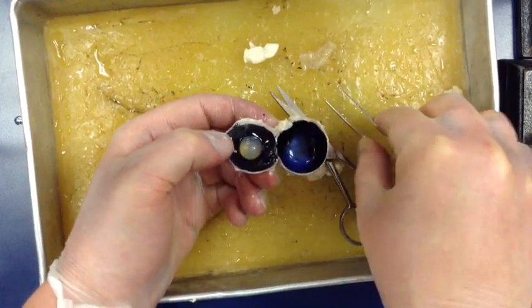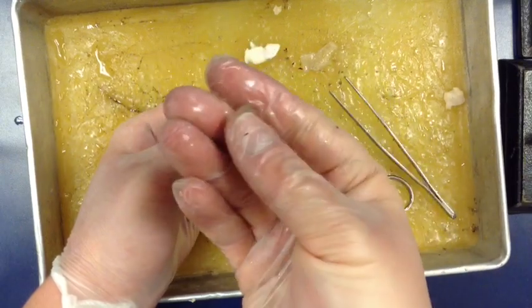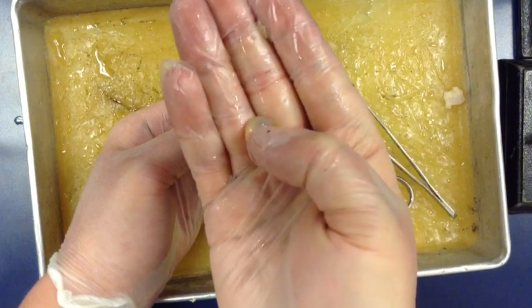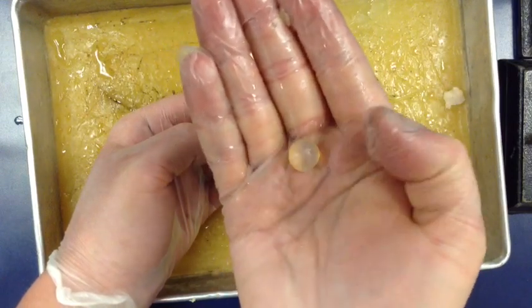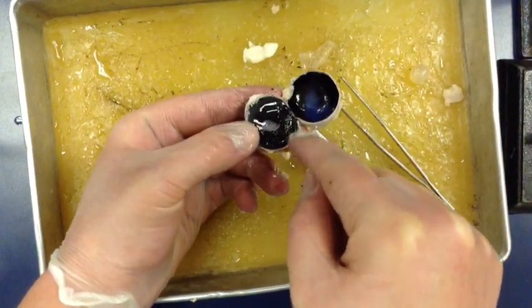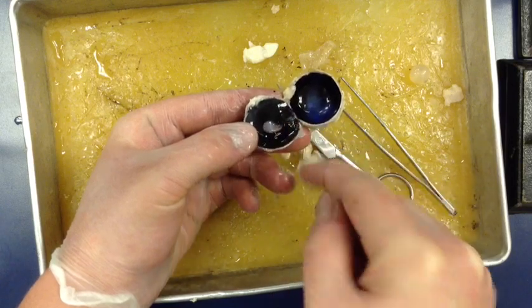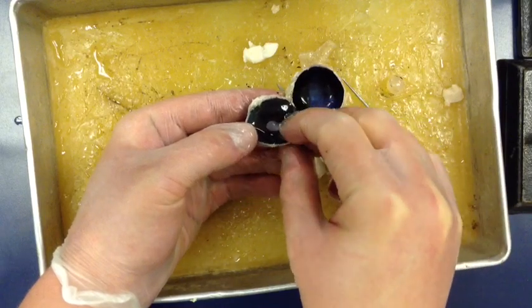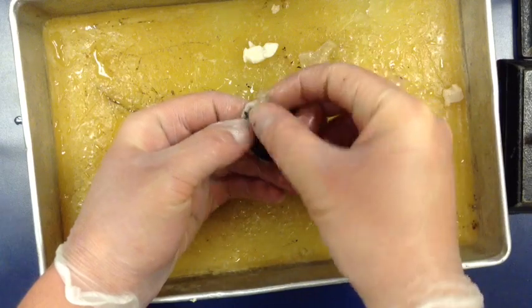This part here is our lens, and it's actually quite hard - not squishy at all. If you cut it open you see a whole bunch of white fibers; it's not full of fluid and it's quite tough, just as tough as in our eyes. If you look closely around here you can see these mushroom-like ridges - that's part of the muscles that control the size of the lens. When they stretch the lens out, they allow the lens to focus further or closer.